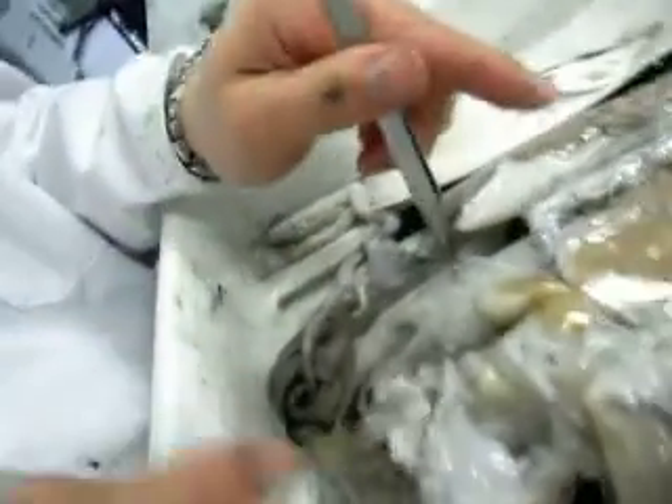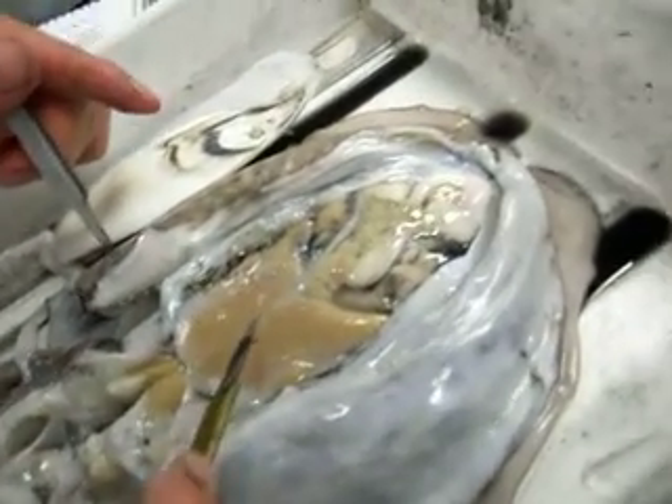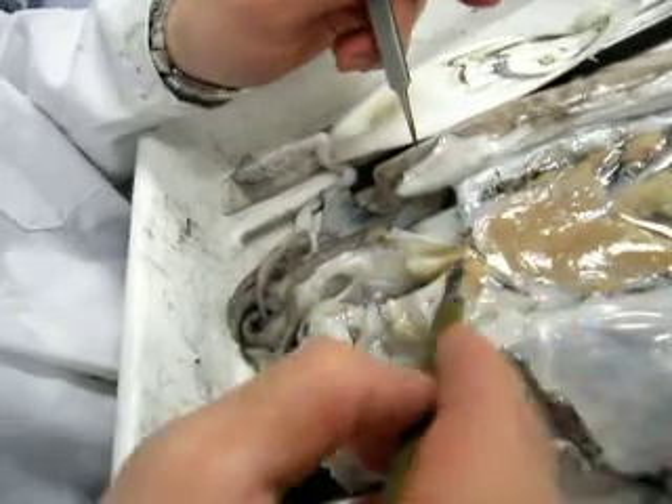Is there anything else that I should look out for when I draw? You can see the liver is quite interesting, because you can't really see the shape of the liver from the ventral side, but from the dorsal side, you can see it's actually two livers.